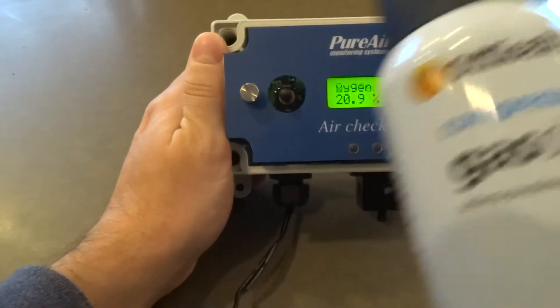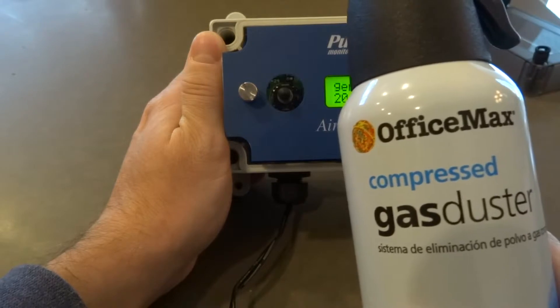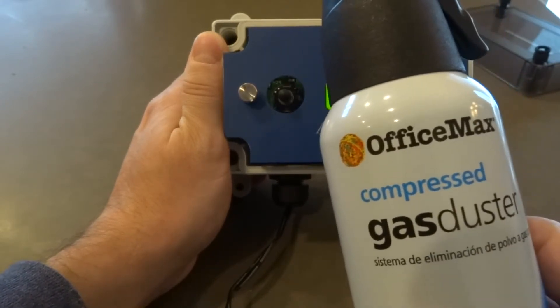I have some compressed gas. This is not the most scientific approach but this is what I have readily available now, and I'm going to subject the sensor now.